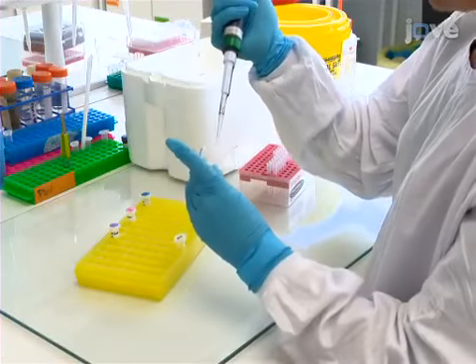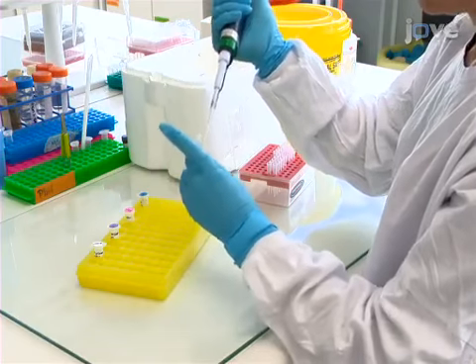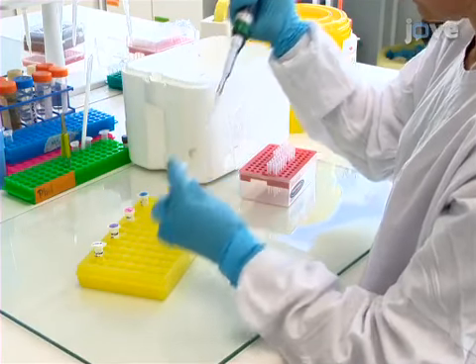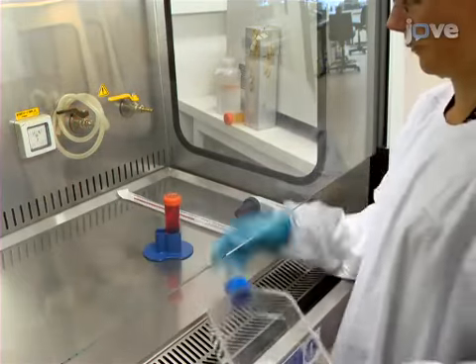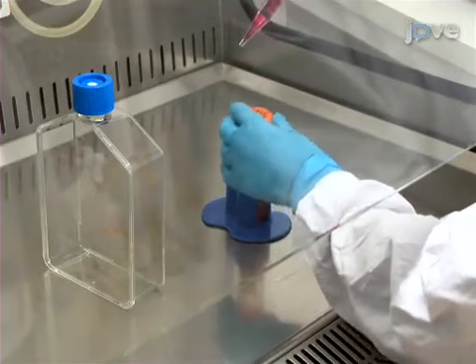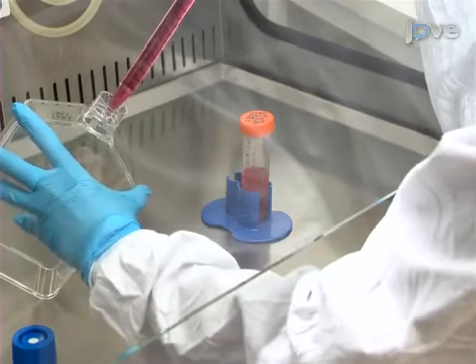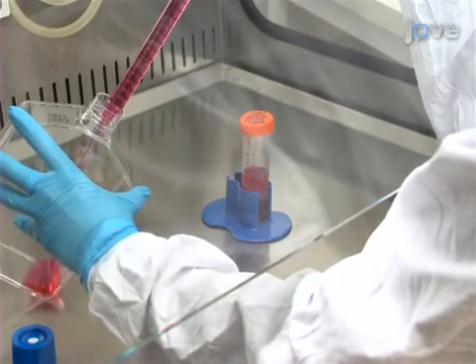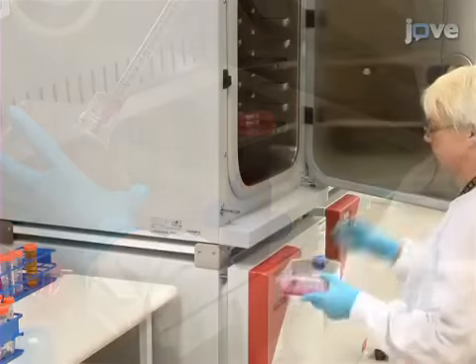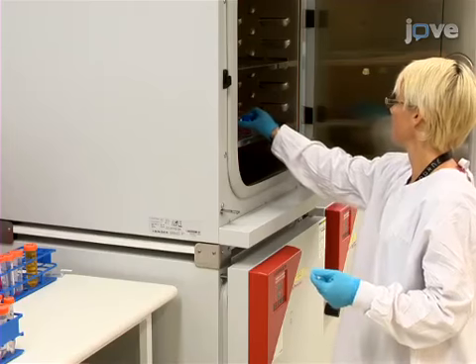In preparation, clone the required 2K7 lentivectors as described in the text protocol. In the morning of the day of transfection, prepare 32 million HEK293 T cells in a T175 flask containing 25 milliliters of media. Critically, these cells must be stuck down before transfection, so plate them sooner if needed.